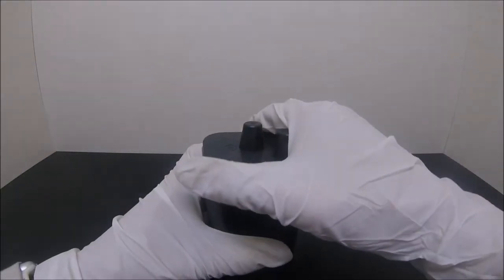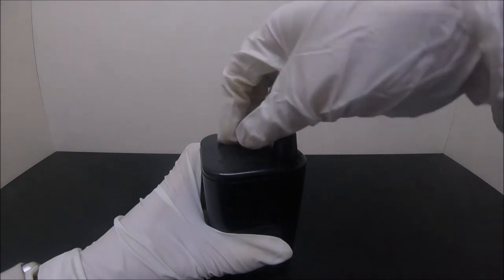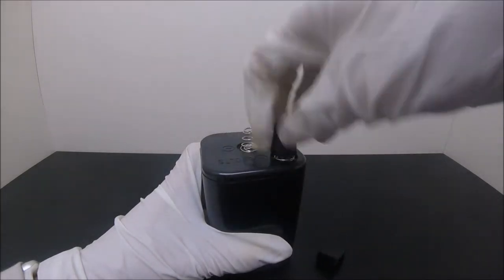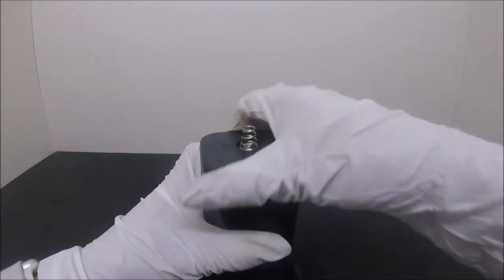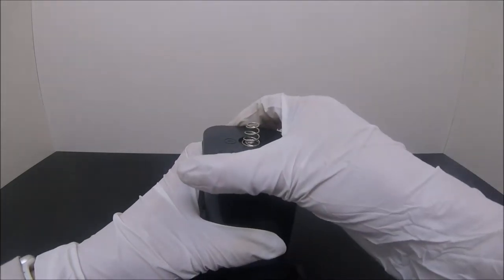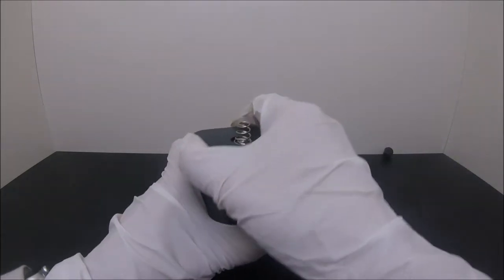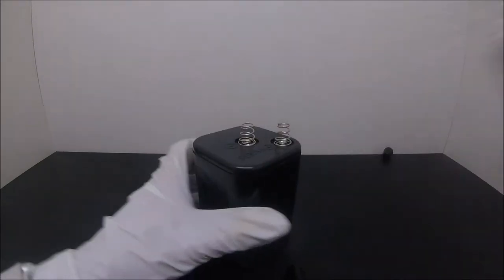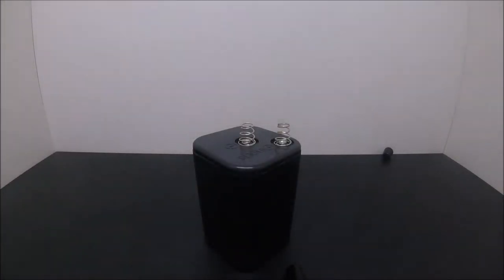Then let's crack the top open. Well, it is somewhat difficult by using bare hands. I'm just a young chemist here, and I have no knowledge in martial arts. So let me grab some tools.